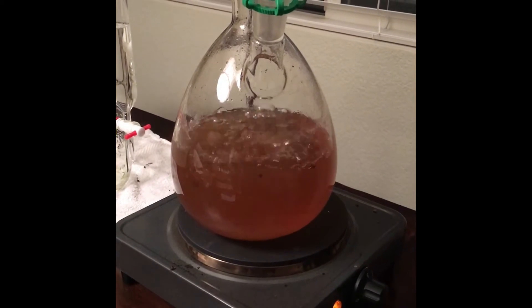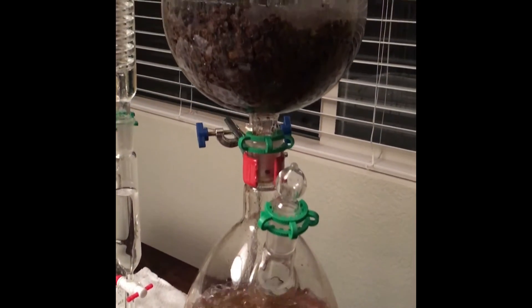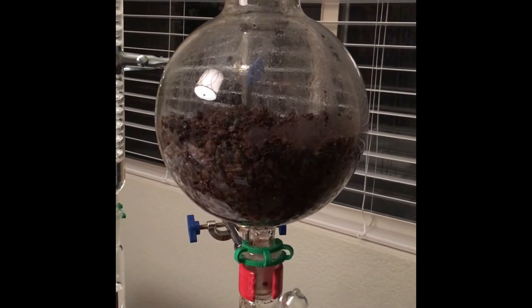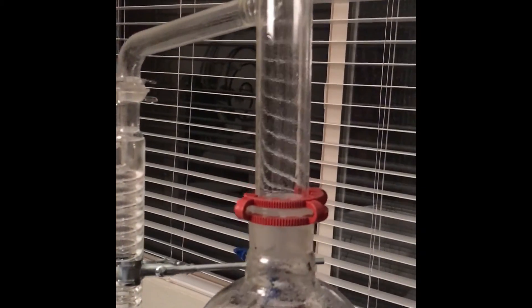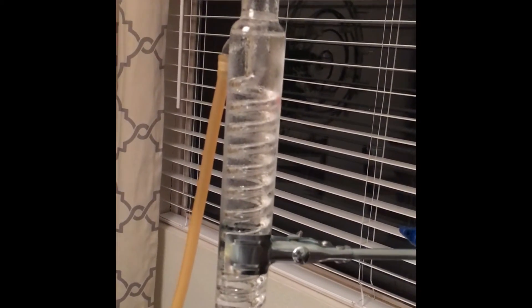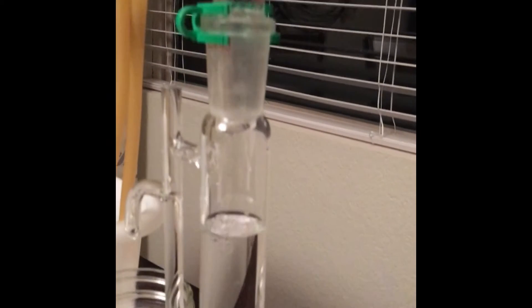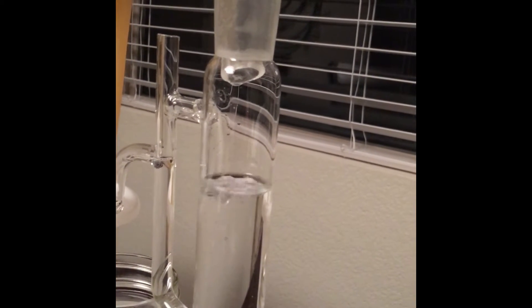Here you've got a hot plate and a boiler flask. The boiling water goes through the biomass flask, which is filled with the allspice, up to the still arm and across to the condenser. The condenser changes the steam into liquid and onto the separator, which separates the oil from the hydrosol.